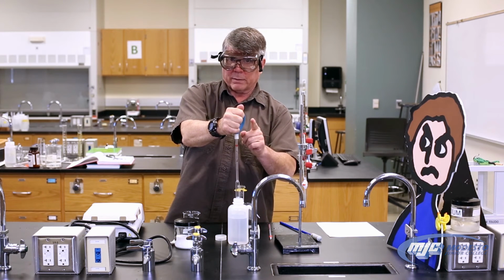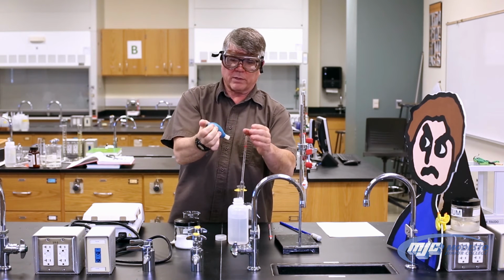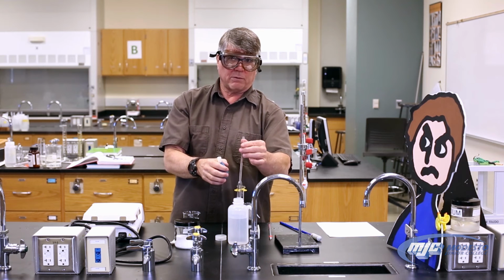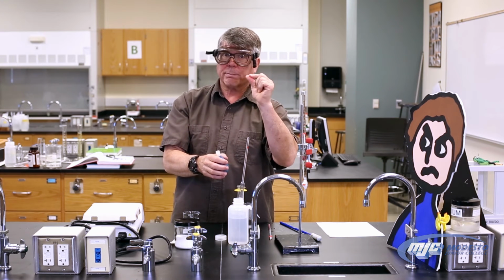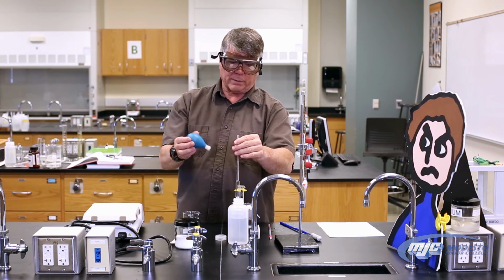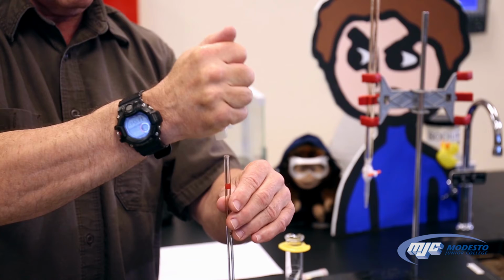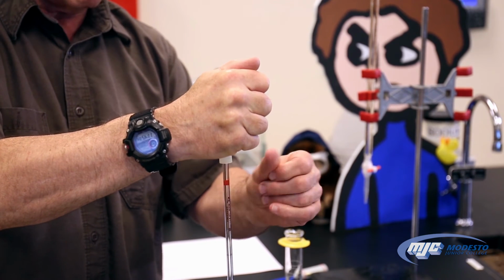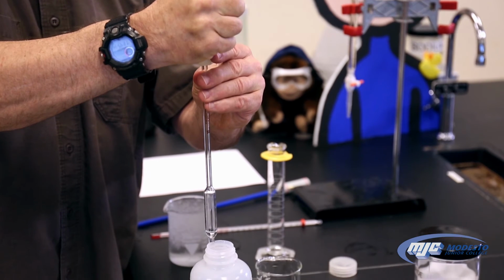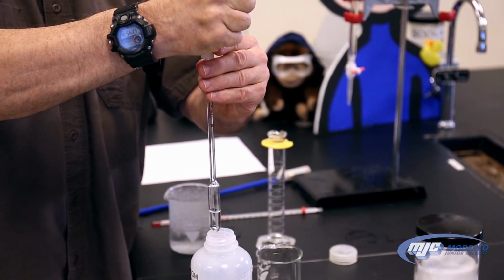Now, one trick that's really important with the volumetric pipette is before you start, you want to make sure that the inside of the pipette bulb is dry, the top of the pipette is dry, and your left forefinger is dry. If any one of those are wet, it makes this basically impossible to do accurately. So I'll show you why in just a sec. Squeeze the bulb, keep it squeezed, place it on top of the pipette, and lift the pipette off a little bit from the bottom and start pulling up the water. And I'm going to bring it up above that mark somewhere.